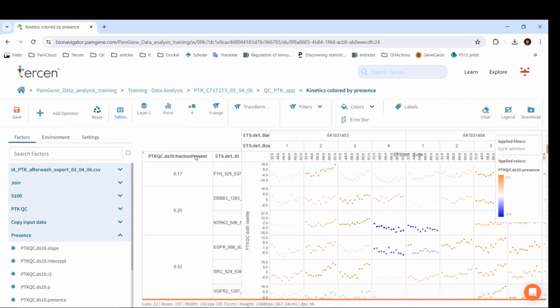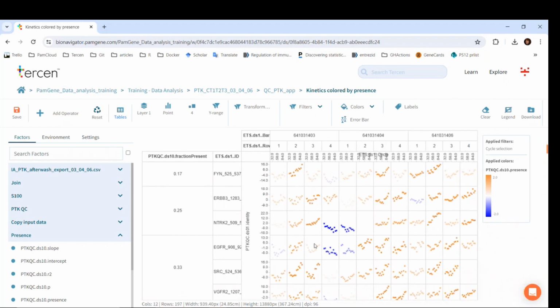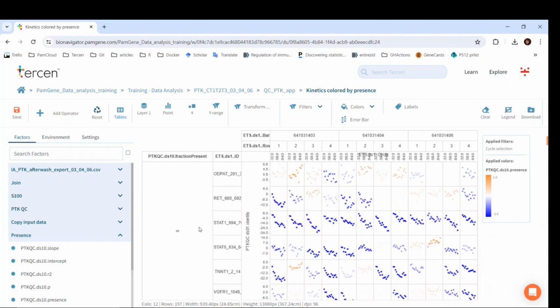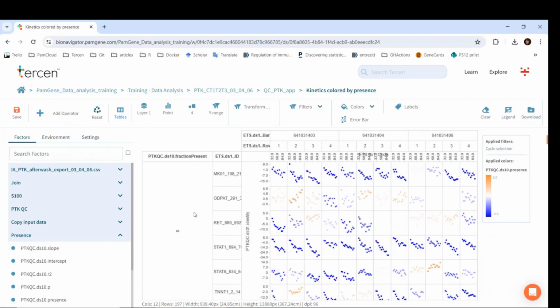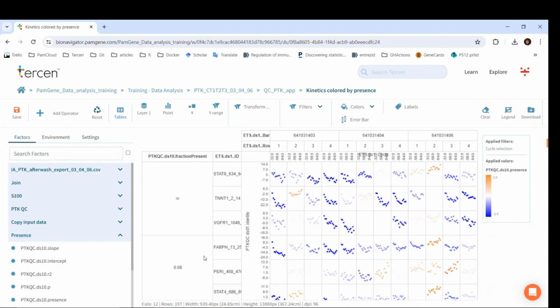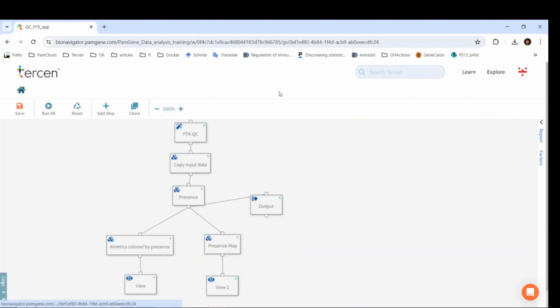Importantly, there is a row factor here called fraction present. This is the fraction of peptides which are present, that is, the fraction of those samples that show a positive trend. Since this factor is the first row factor, the peptides are sorted based on this. You can see that more blue peptides, which show up in fewer conditions, are on the top, and the orange ones are at the bottom.